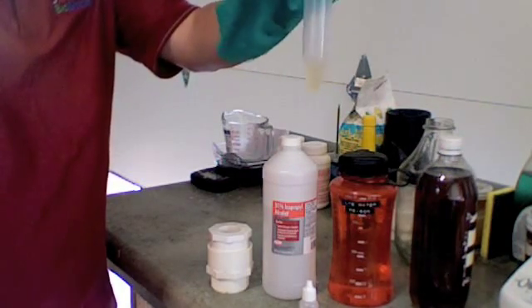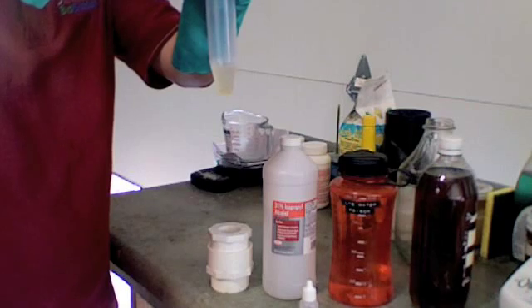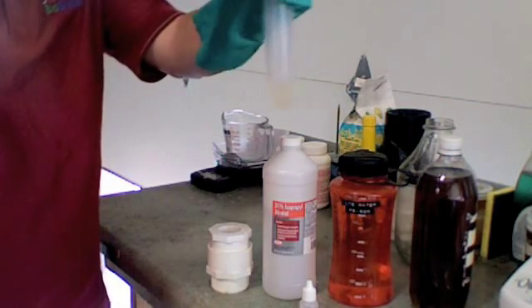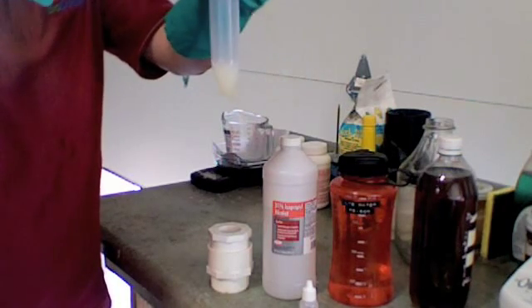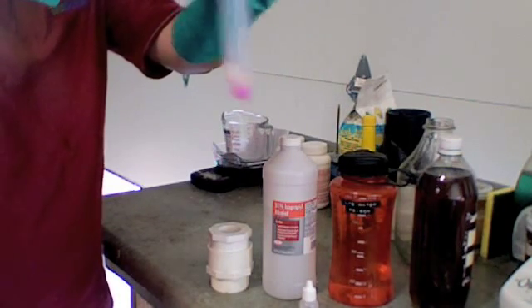There's point one, no pink. Point two, no pink. Point five, no pink. One point zero.